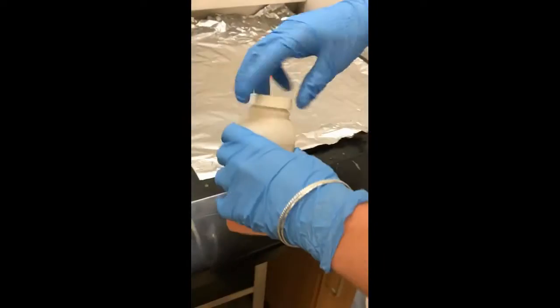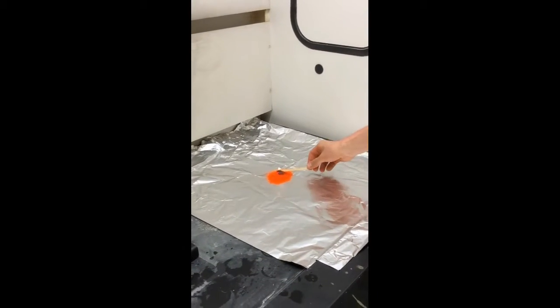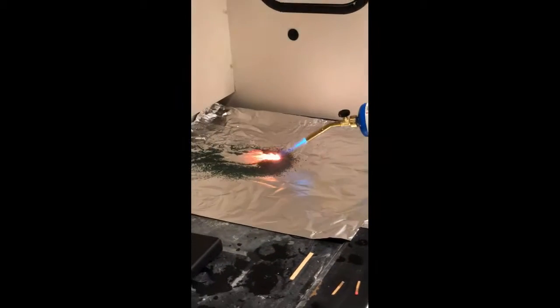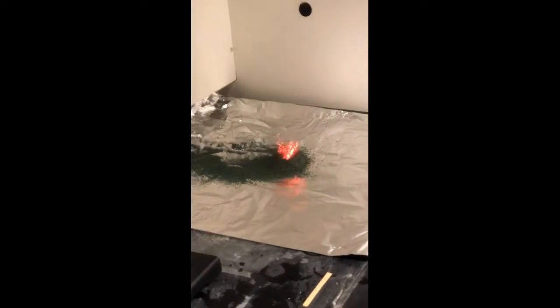Then we placed the ammonium dichromate in a small pile on the aluminum foil. At first we tried using a match, but it was clearly not enough to light the reactant. So we turned up the heat and used the blowtorch. After numerous seconds of using the blowtorch on the small amount of ammonium dichromate, the reaction began to occur violently on its own, and the torch could be removed.